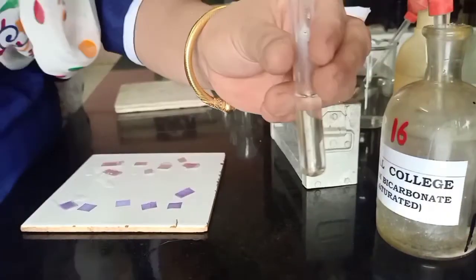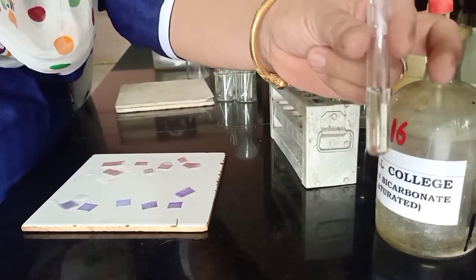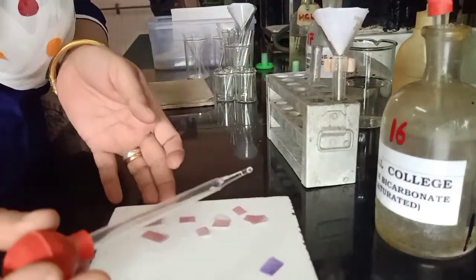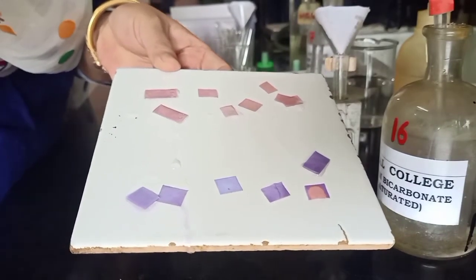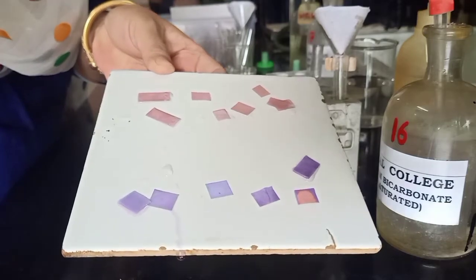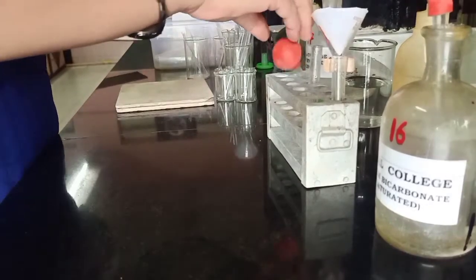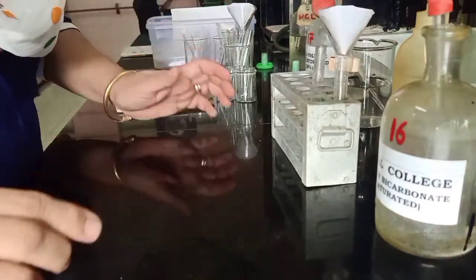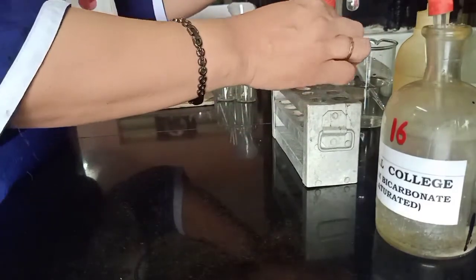Let's check whether the medium is acidic enough. I will take a few drops of this filtrate and put it on a blue litmus paper. As you can see, it turns red, clearly indicating that the medium is acidic, but still there is no re-precipitation. No re-precipitation that follows effervescence indicates the presence of a water-soluble acid. We will be confirming the presence of a water-soluble component later if it is present.